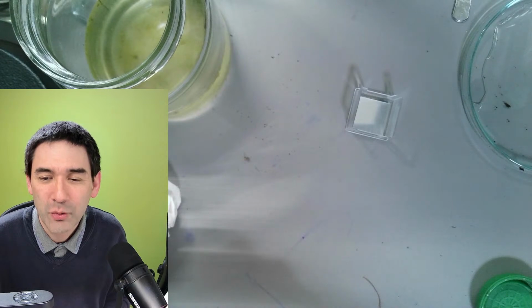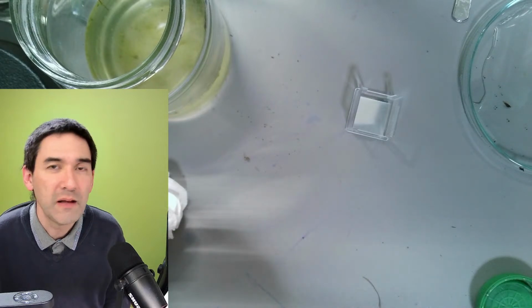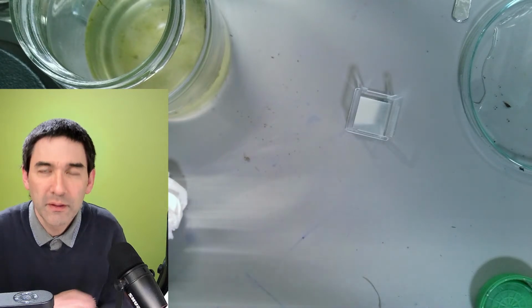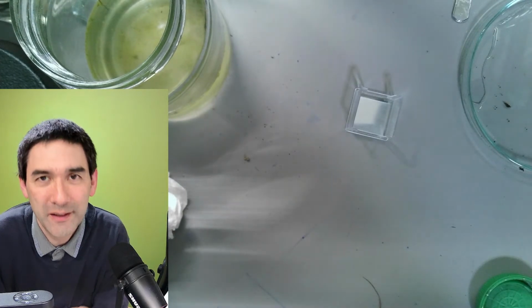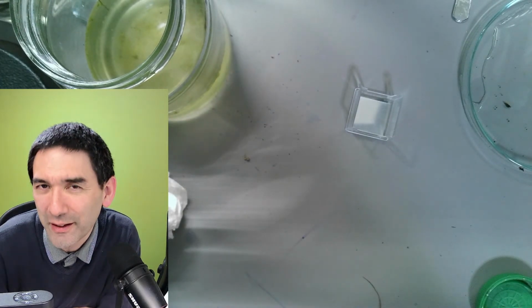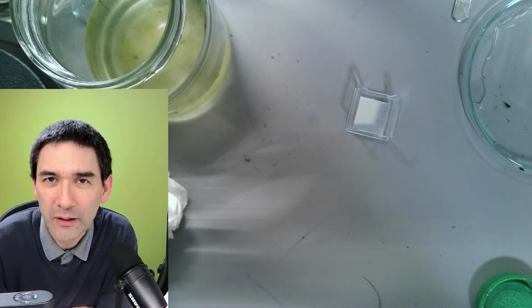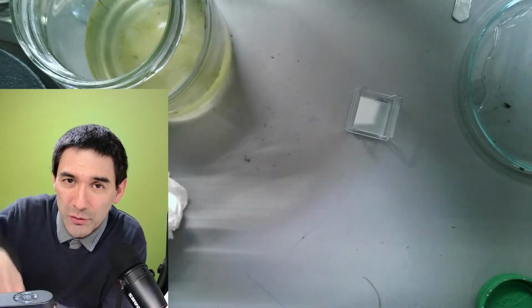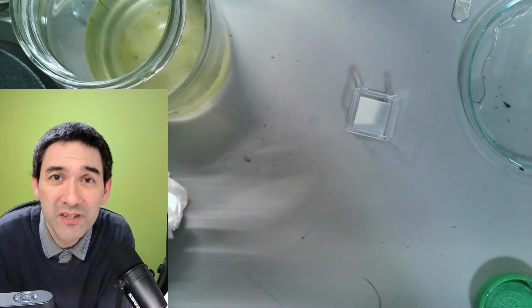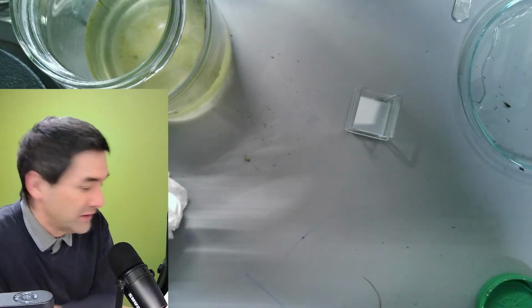Quick question: any microscopy ideas with bananas? Yes, of course. I can quickly tell you. You take a very soft banana, a small piece, and you add a little bit of iodine to the banana. It also works without iodine, right? And you squeeze the banana between the cover glass and the microscope slide. You put some tissue paper on, you squeeze it, and you're going to see the banana starch grains. The banana starch grains are quite nice to look at.